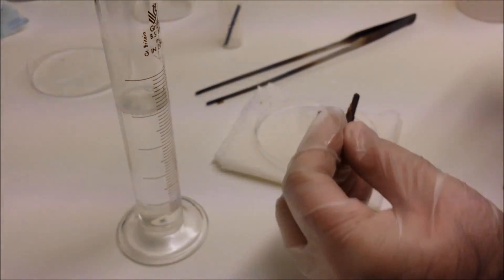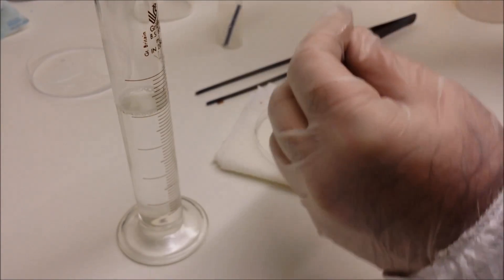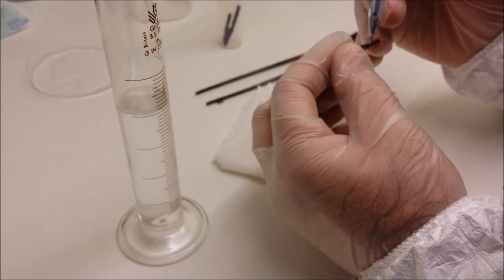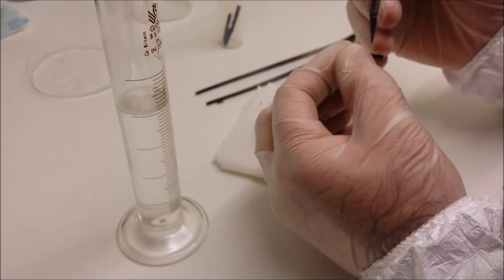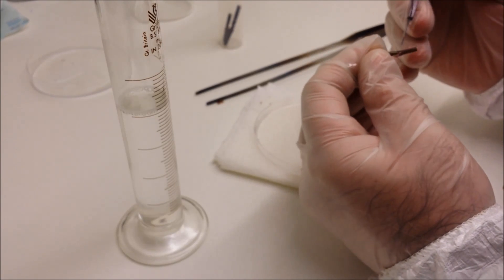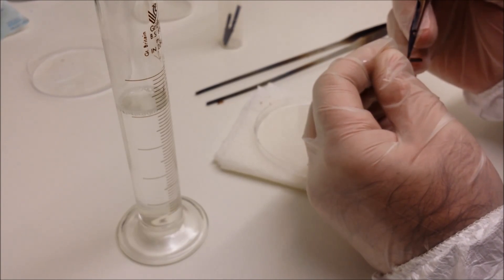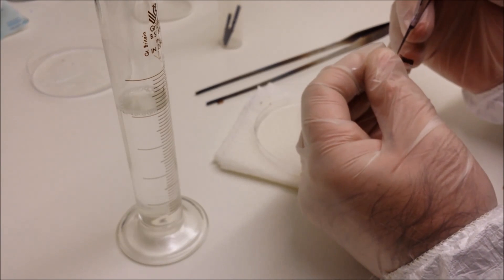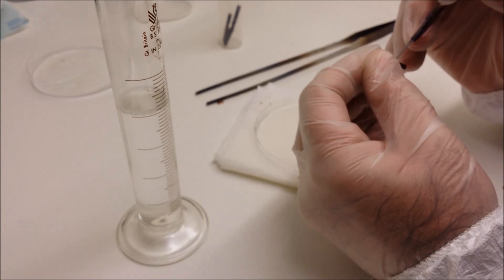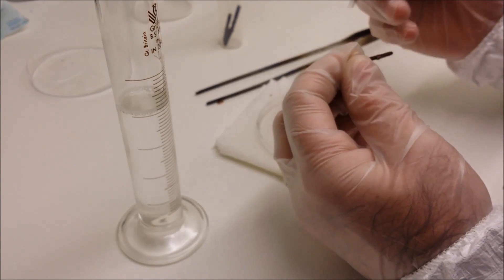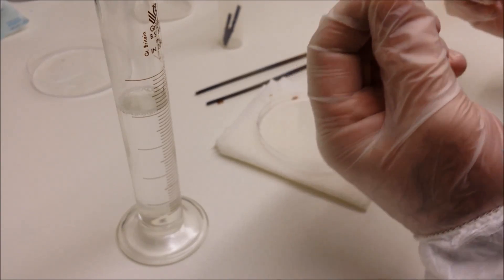Now this is the final one, and again we're going to take off that sheath as careful as we can.